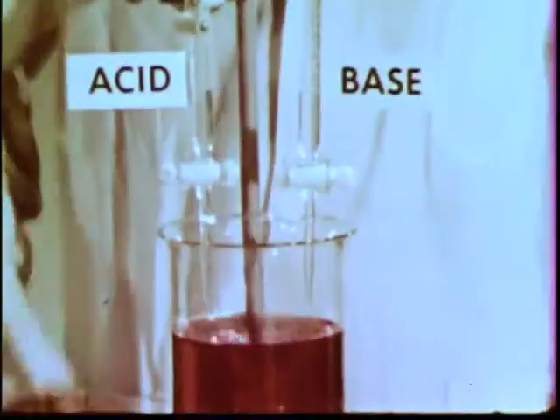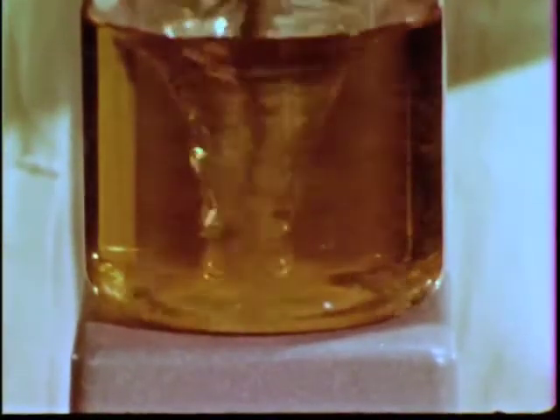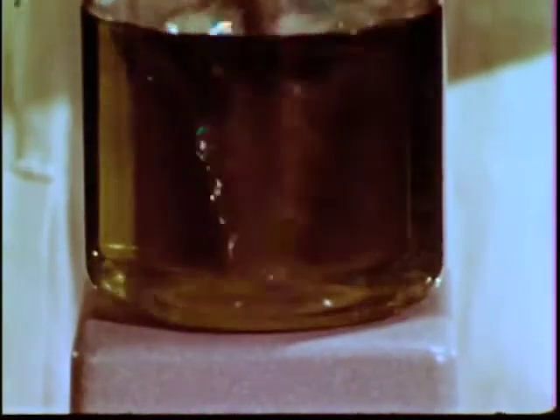Let's stop adding acid and add base to the indicator solution. The strongest acid, methyl orange, donates protons first — the solution is again orange. Next, the methyl red donates protons, leaving only yellow forms in solution. Each indicator changes color over a narrow acidity range, depending on its acid strength. Continued addition of base allows the weaker acid HBB to donate protons. Finally, the phenolphthalein donates protons as the hydrogen ion drops to about 10 to the minus 9th molar, and the solution turns violet.